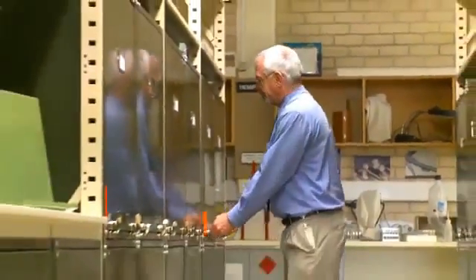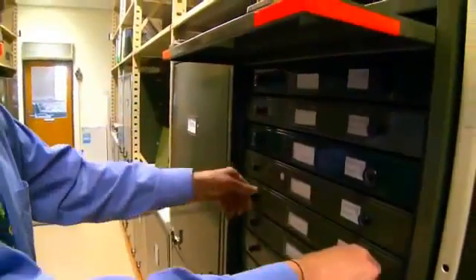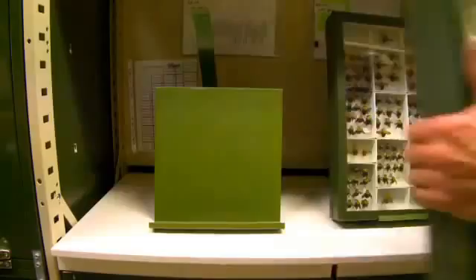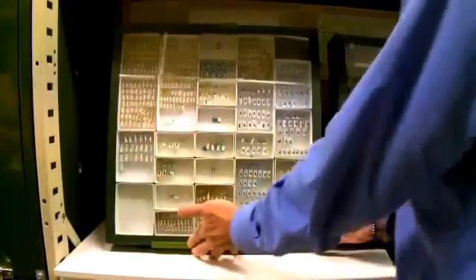One application is to understand the biodiversity in a local environment. Another is in conjunction with CSIRO Entomology — they've got a huge collection of insects used in pollinating, not just bees but beetles. The instrument will help assess what species are important to which ecosystems.